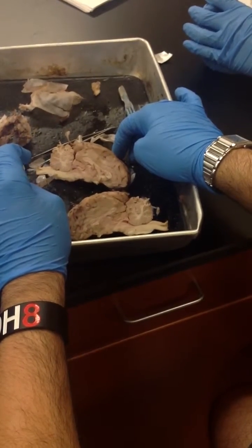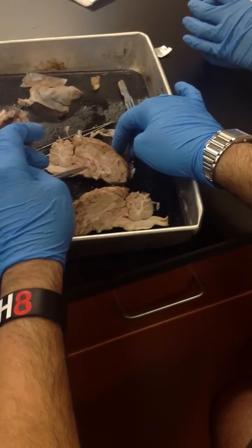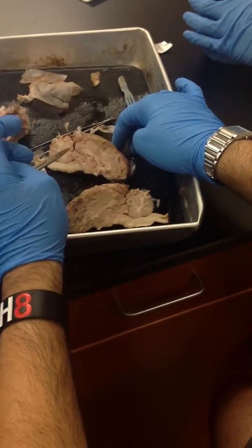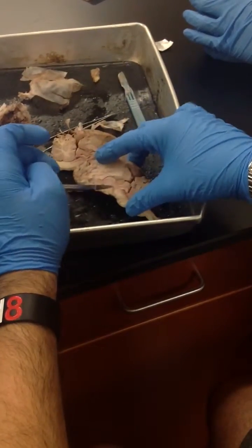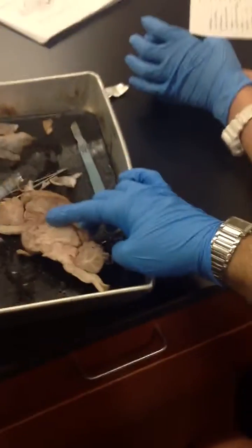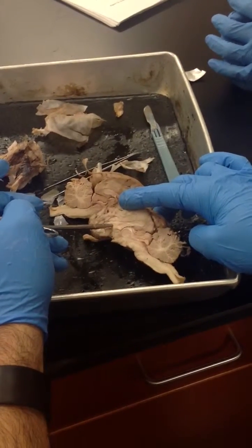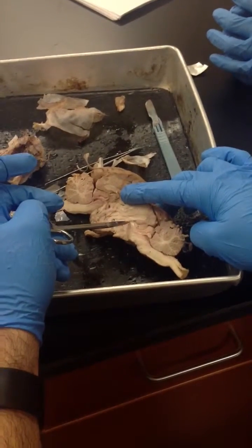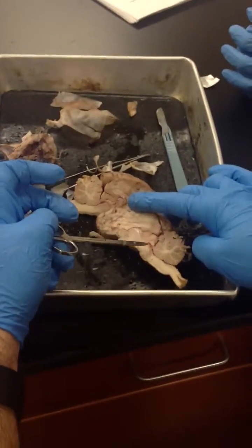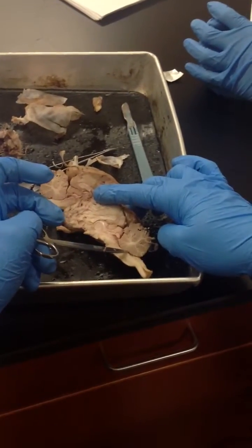Here would be medulla oblongata. Here would be pons. Here would be thalamus. Here would be superior colliculus. Here would be inferior colliculus. Here would be pineal gland or pineal body. If I ask for what is this space, it's the lateral ventricle. If I ask for what is this space here, it's the third ventricle, even though it kind of goes around the thalamus too. This space here would be the cerebral aqueduct. And this space here would be the fourth ventricle.